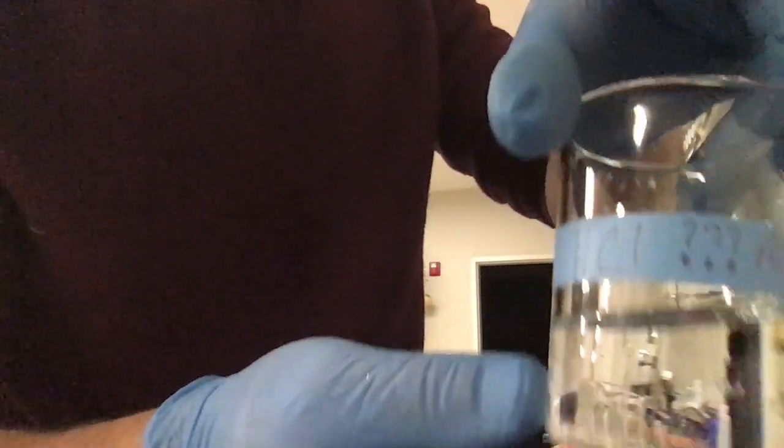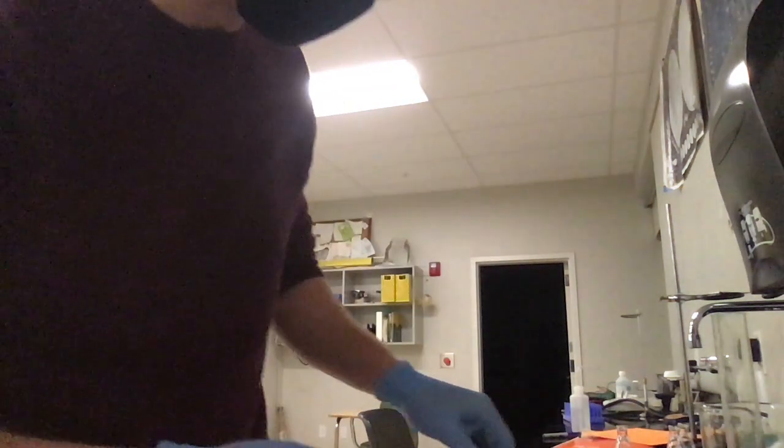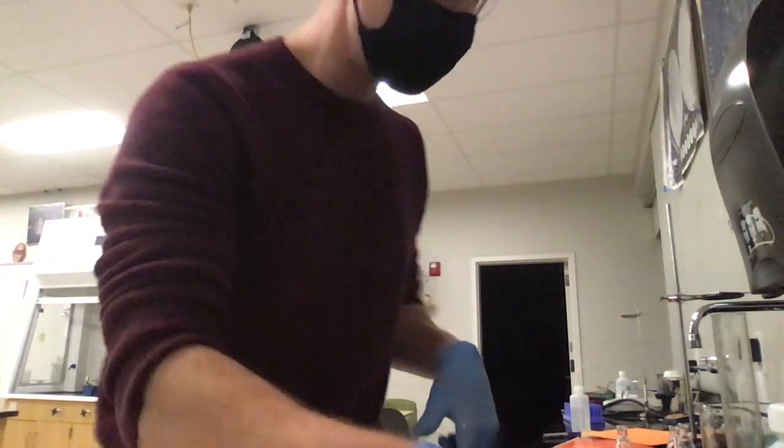I have my unknown acid. This is one of my favorite labs because it's so rare that you get to put unknown on a label. I've got my indicator, my phenolphthalein.